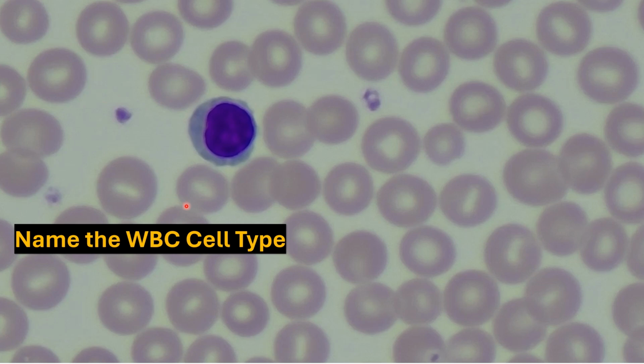Now this image has been cropped and zoomed in a little bit. First thing that stands out is there's a single nucleus in this leukocyte, and that single nucleus is roughly the same size as any one of these red blood cells that surround it, with the entire cell just being slightly larger than a red blood cell. So right here is the cytoplasm, and overall it's not granular because we can see it, there are no dots that are visible. And with that should let us know that this is a lymphocyte. It is our second most common cell, the let in never let monkeys eat bananas, a lymphocyte.